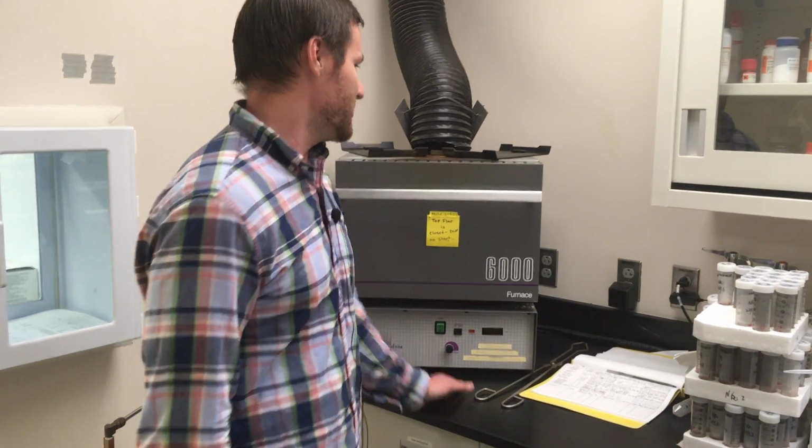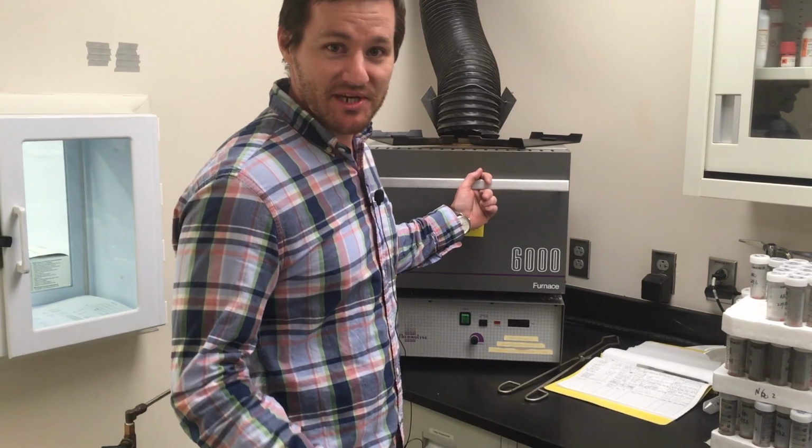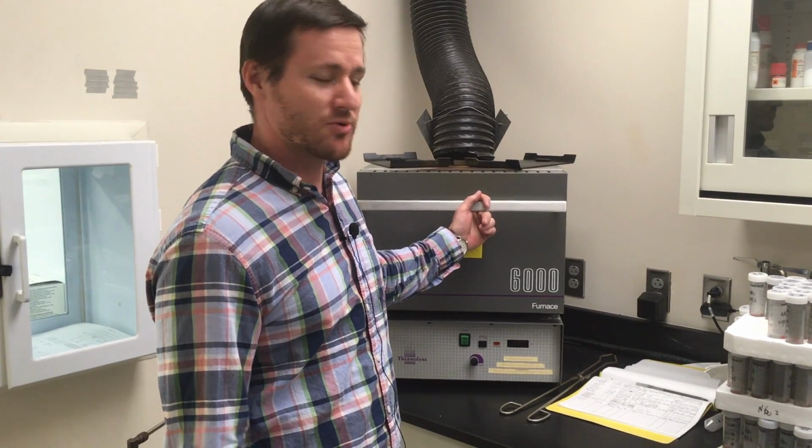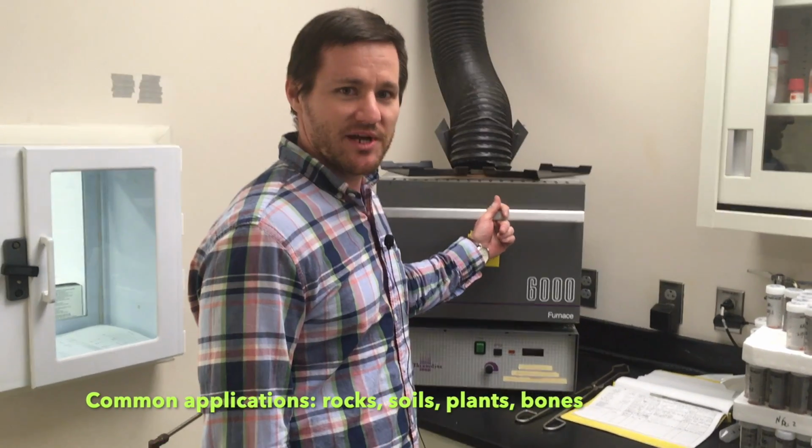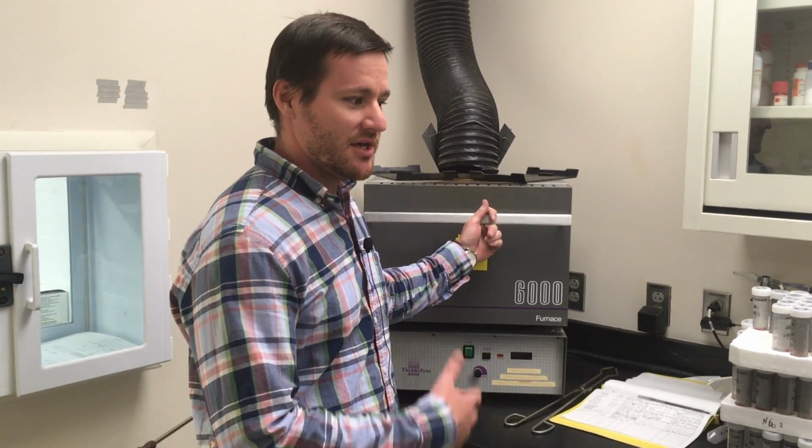Hello, today we're going to learn a little bit about our asher we have here in the Keck Lab. So one might ask, why would we use an asher? Typically for our purposes, we like to use an asher when we have a sample that's really rich in organic material. And so this is a good way to kick up the temperature and get rid of some of that organic material.